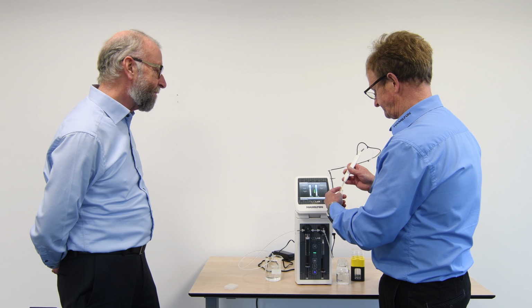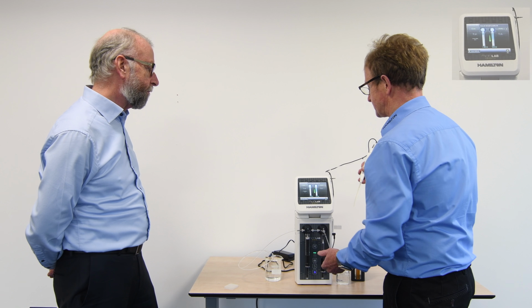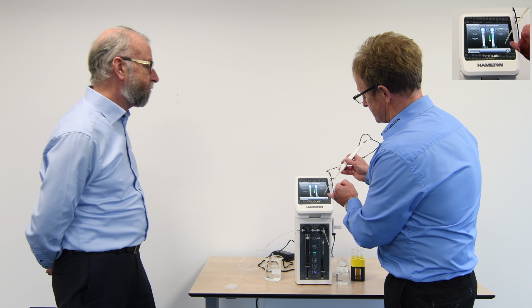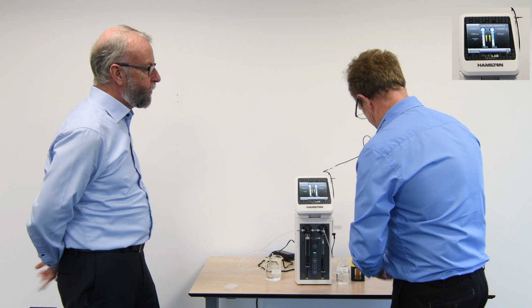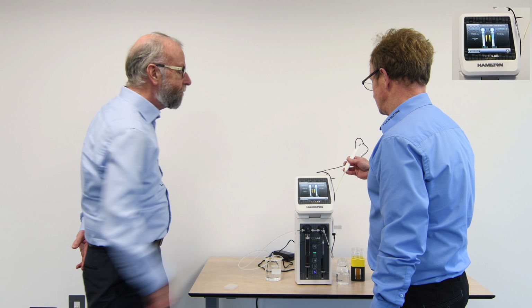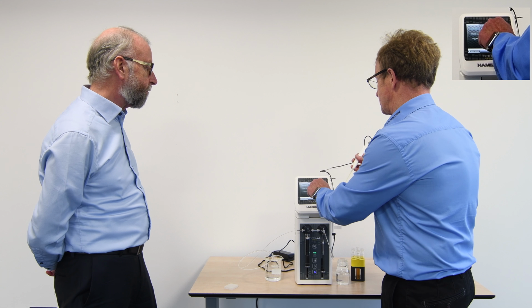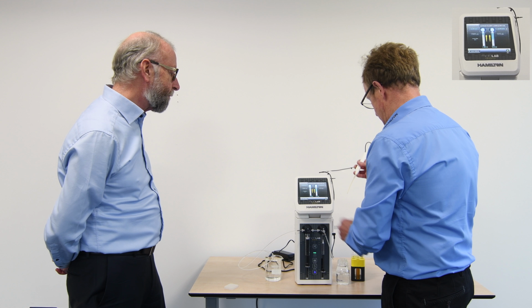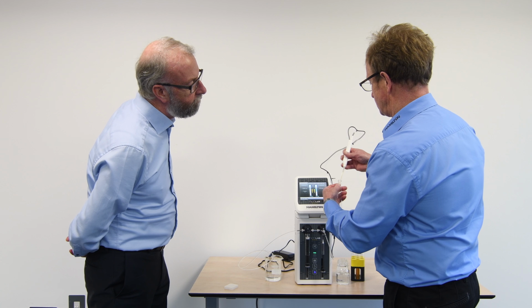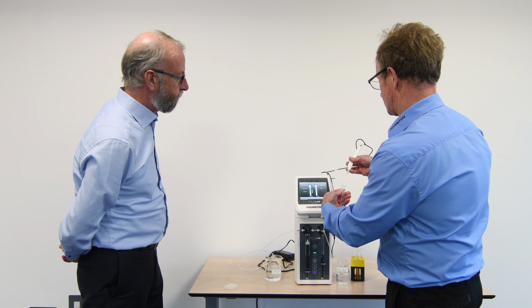Yeah, good. And we've picked up sample as per the previous step. And you remember what the next step was, pick up an air gap, and we can say pick up air gap and wipe tip. So I can do just that. I can pick up a small air gap. So you wouldn't accidentally have the tip in liquid. Exactly. At that step with this text here. Okay. That's exactly the point. And now we've wiped our tip, and now we can actually dispense. It says dispense the diluent and the sample into the vial we're using. So we select our vial, add that into the unit, and you can see this sample, air gap and diluent came across.